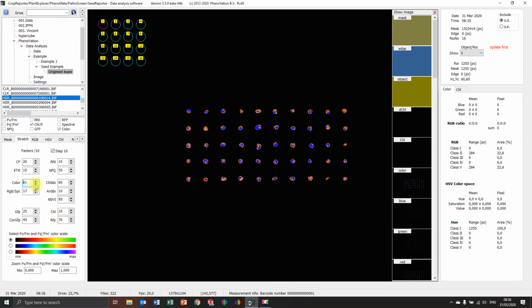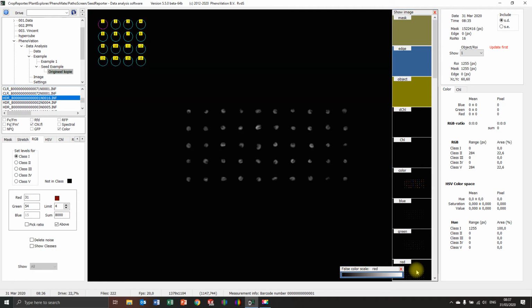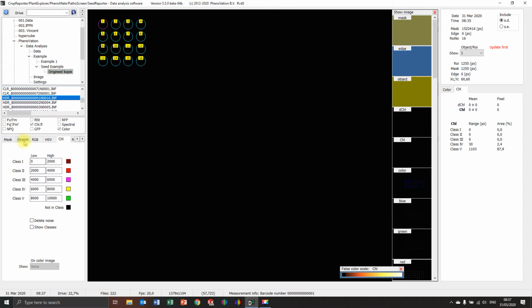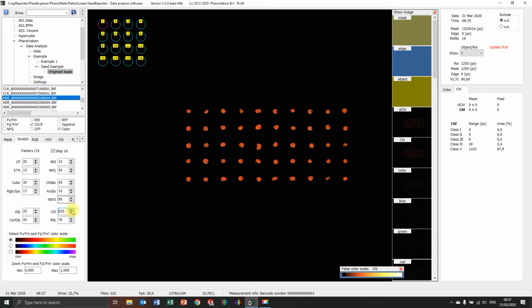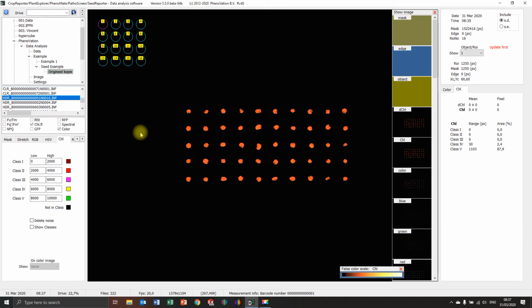Oh, I don't see the background. Why don't I see the background? Really dark background. Normally I would see the background if I stretch it enough, but maybe I'm just too precautious. Then I'm going to stretch the chlorophyll. I should see it on this one. Oh, this one. No, also I don't see it. Well, normally I would see it, but it's a little bit dark. Well, no problem. I would just use the chlorophyll.